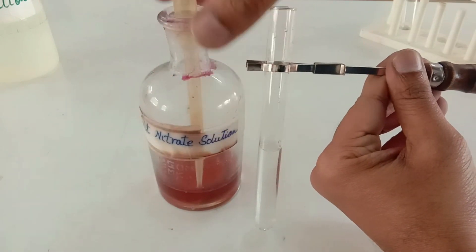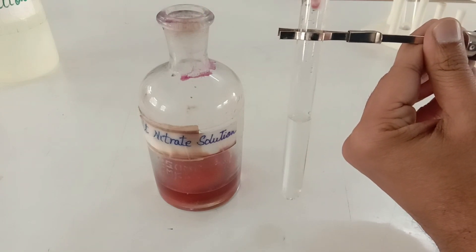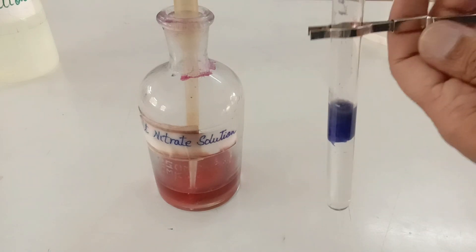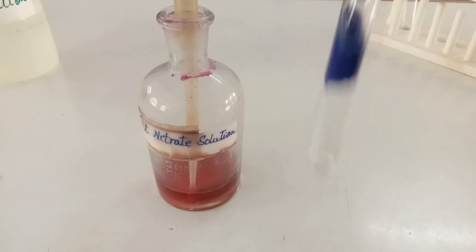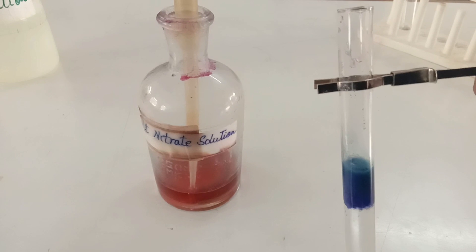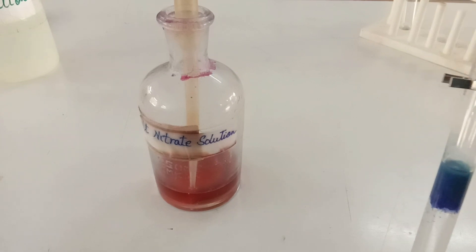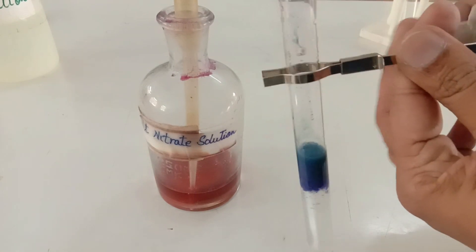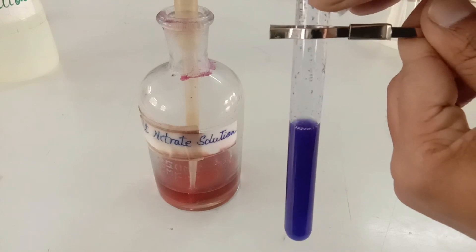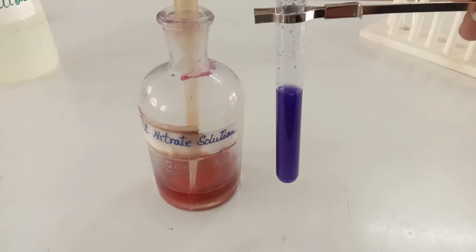About 1 ml of cobalt nitrate solution, which is orange in color, is to be added into the food sample. You can see that when cobalt nitrate solution comes in contact with the food sample it turns violet in color. I'm going to cover the mouth of the test tube with the help of a paper and stir the mixture. The entire solution becomes violet in color. If cobalt nitrate solution, which is orange in color, turns violet, it indicates the presence of sucrose sugar in the solution. This is the confirmatory test for sucrose sugar.